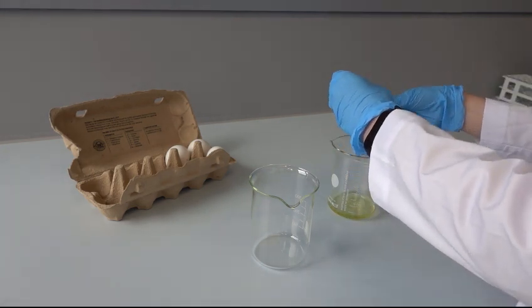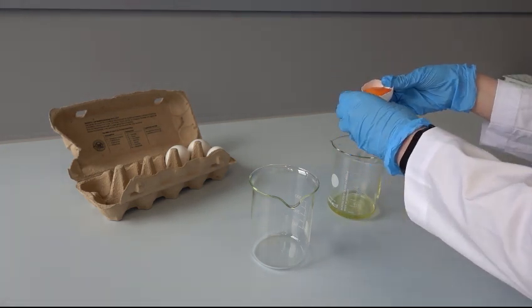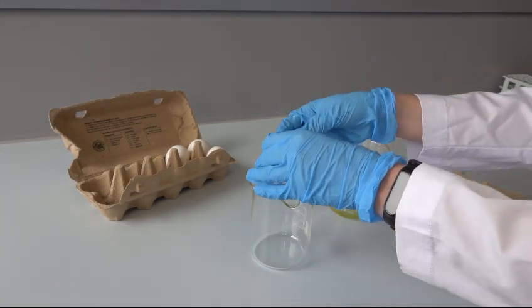Try not to get any shells into the egg white and wear gloves during the separation step to avoid contamination.